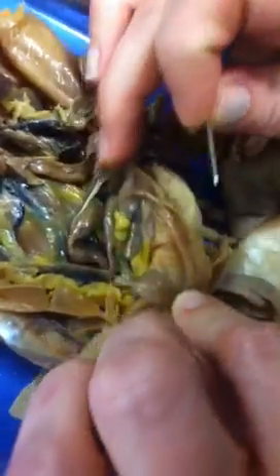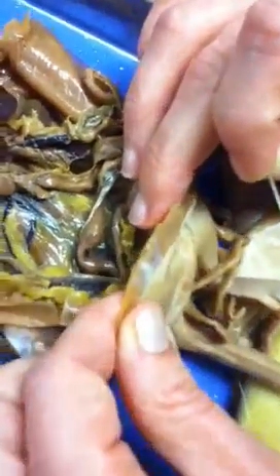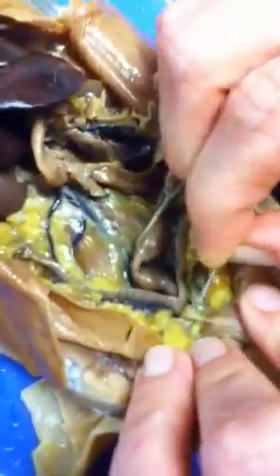It's right there. Your finger's having it. This? No, that's the... I had a pen attached to it. Yeah, that might be it. The small one just isn't inflated. It won't look like that. It'll be a larger structure.